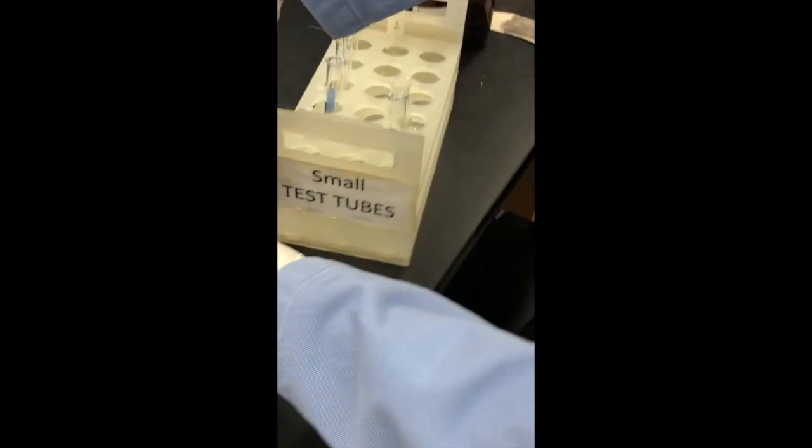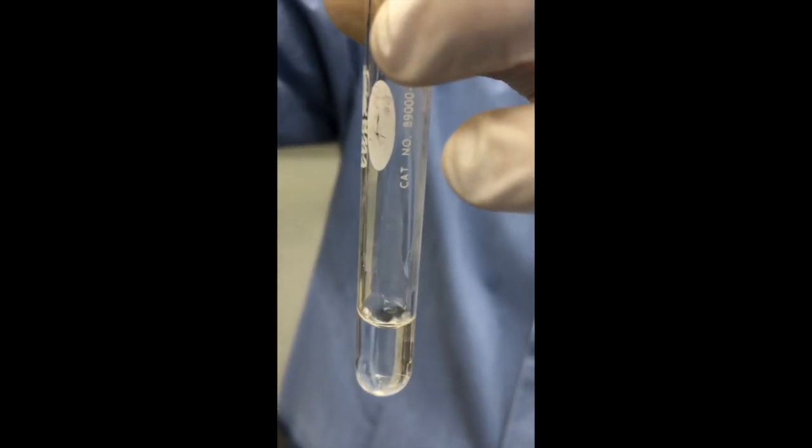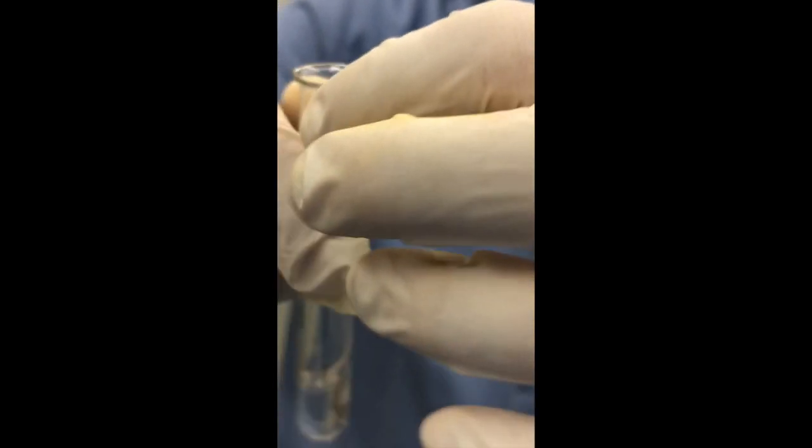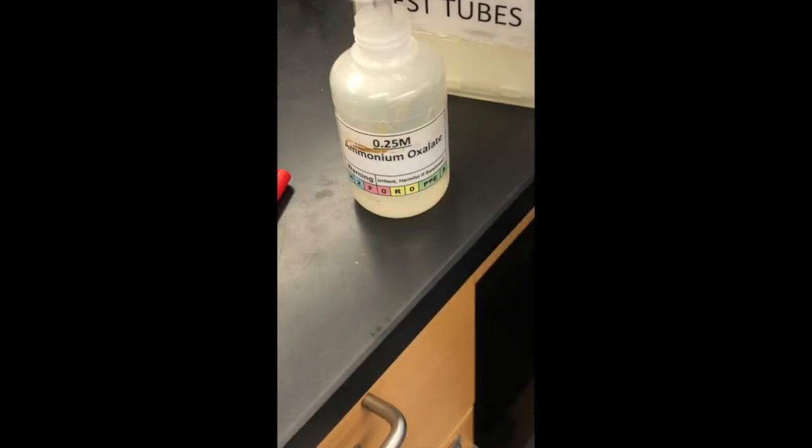Similar procedure for unknown number two. We make three test tubes with unknown number two and add sulfuric acid to the first — observing if there's a precipitate. Because there is no precipitate, we decide next to add a solution of ammonium oxalate. By observing whether or not a precipitate forms after adding ammonium oxalate, we will know the identity of our cation.